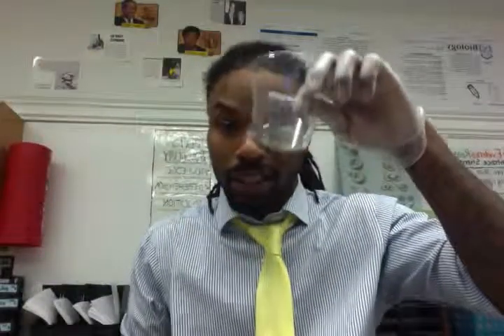And as we do this, continue to think about our phenomenon of Jennifer Strange and how she passed away from drinking or consuming too much water, all right? So the first step in this process, whoever is number 3 in your group or closest to number 3 will come up. You will get a cup, a clear cup, and you will also get an egg, all right? So in this experiment, our egg can represent a cell.